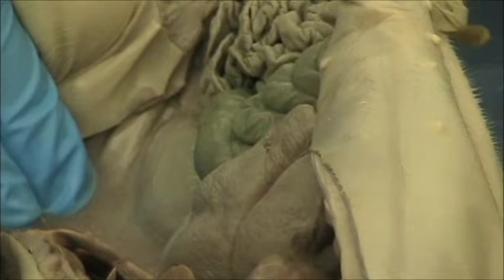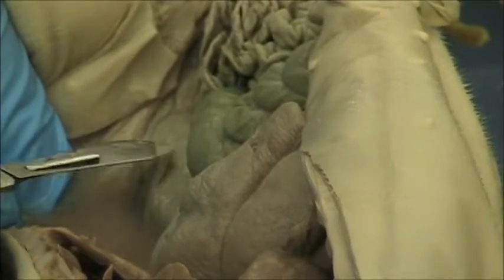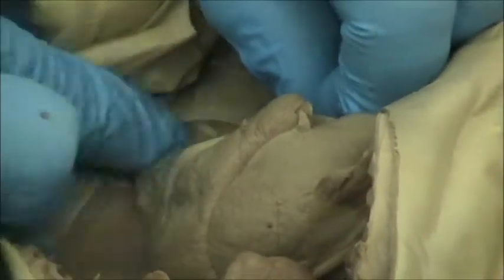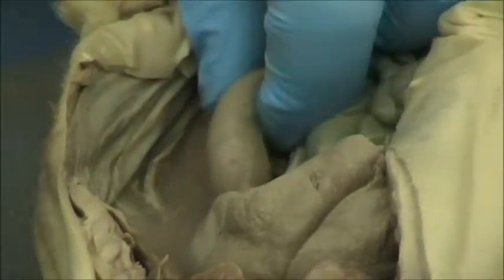So we just take our scalpel, and actually we could just take our finger and just pierce the peritoneum, or we could use a scalpel as well, either one. And as we do that, we see that indeed the kidney is right behind there and being protected, as we said. And so what we can do now is actually dissect the kidney out. We see now it's clearly a kidney. And we can easily just take that kidney out and just cut through the hilus. And there now we have the pig kidney.